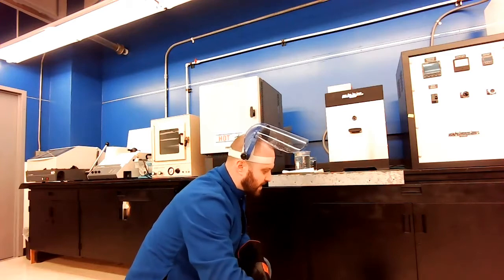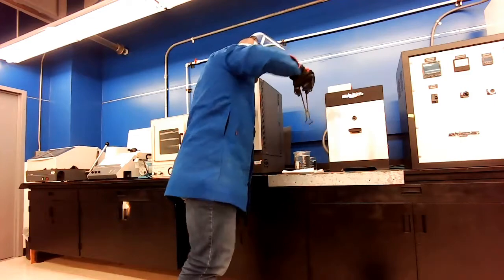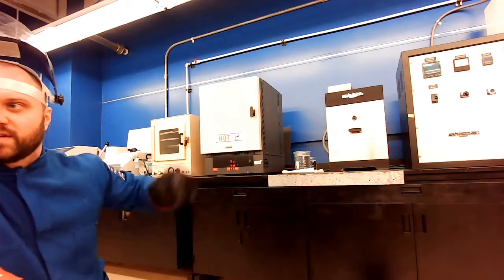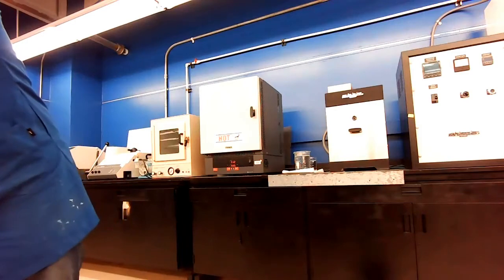So this has been quenched down. There's no more bubbles coming off. I'm going to take this and put this into a beaker of regular water. So I want to get that salt water off of that surface, and I'm going to rinse it in 2 stages, okay? Now, I'm not quite done.